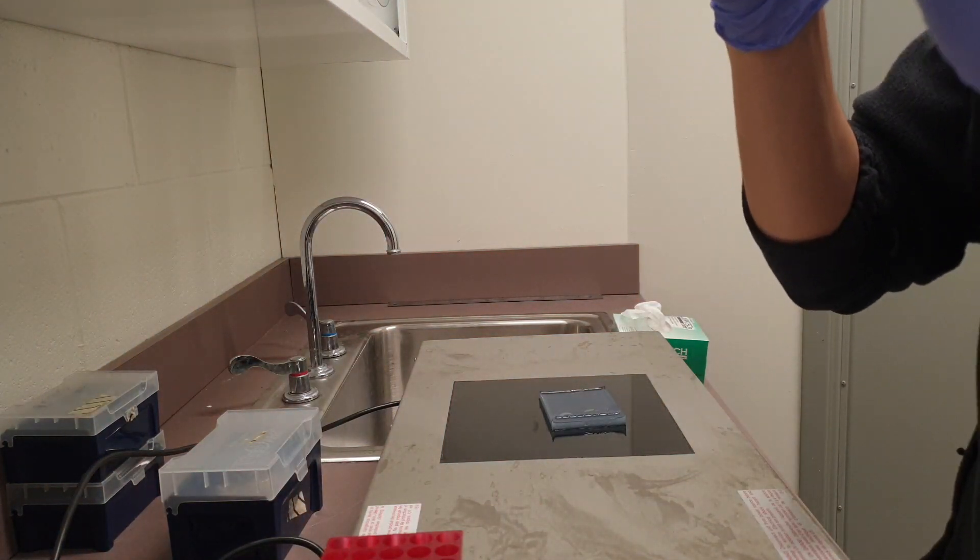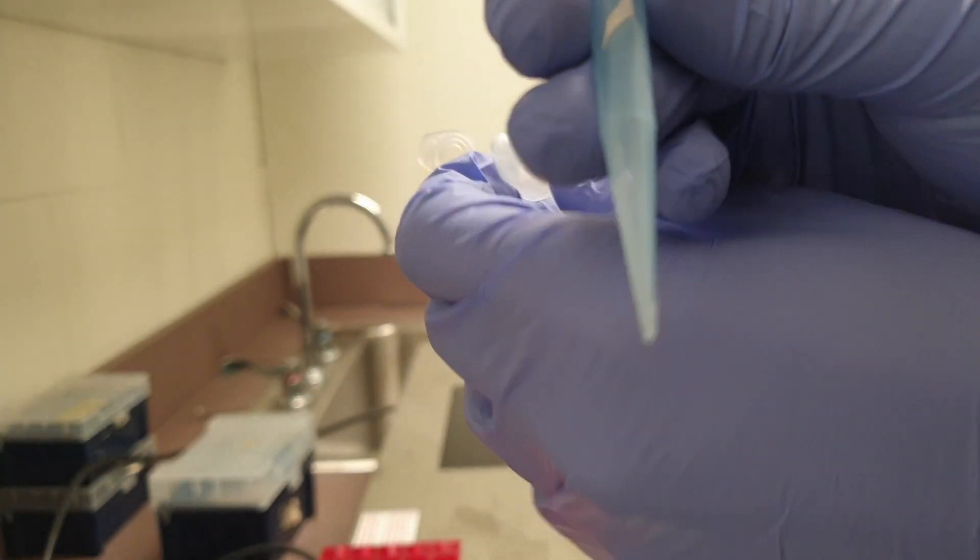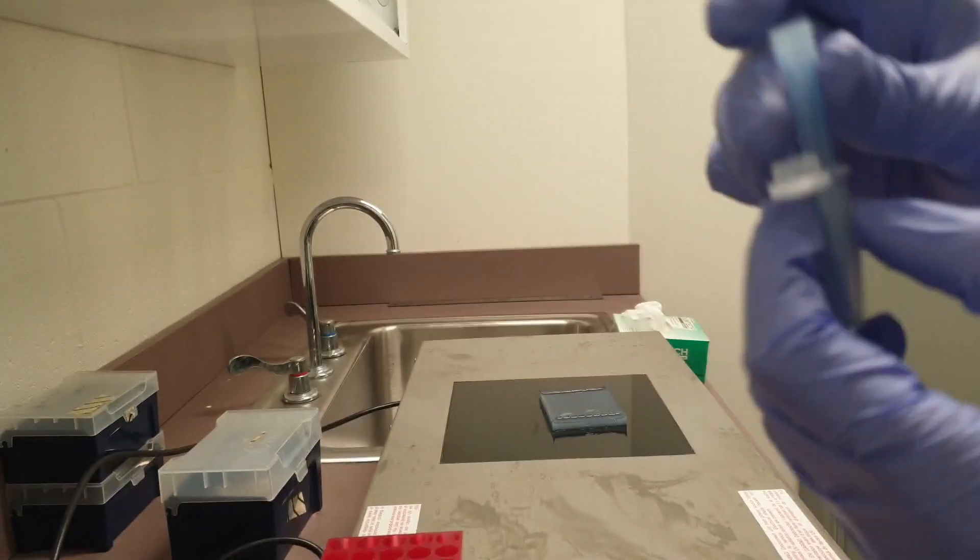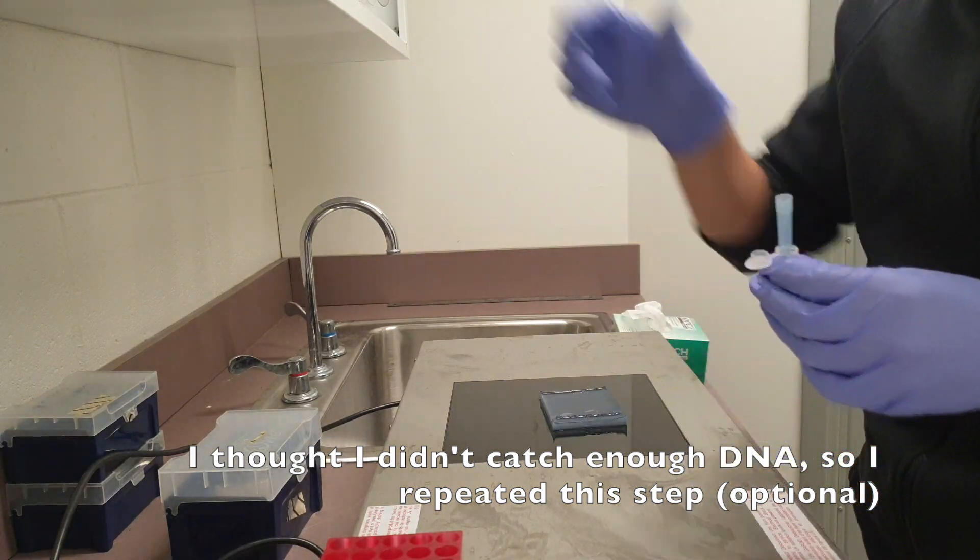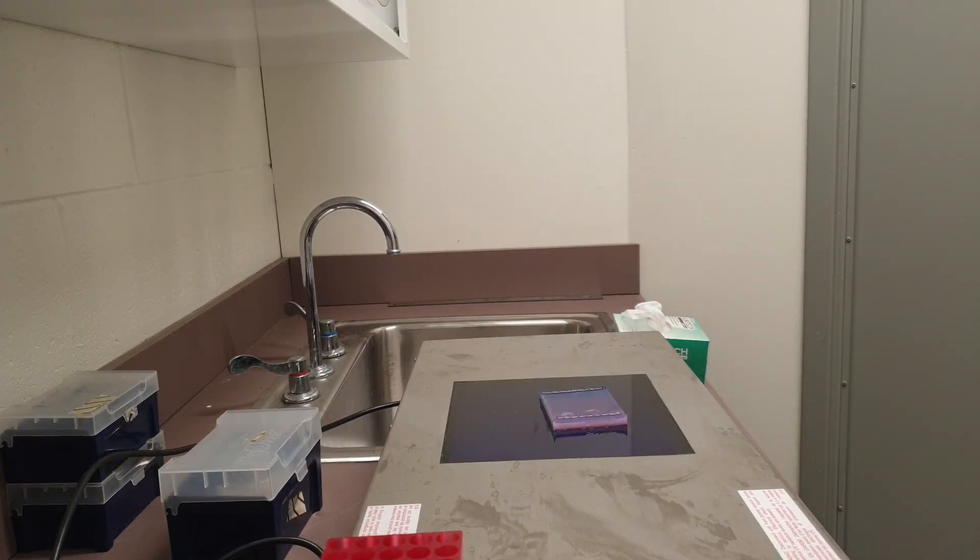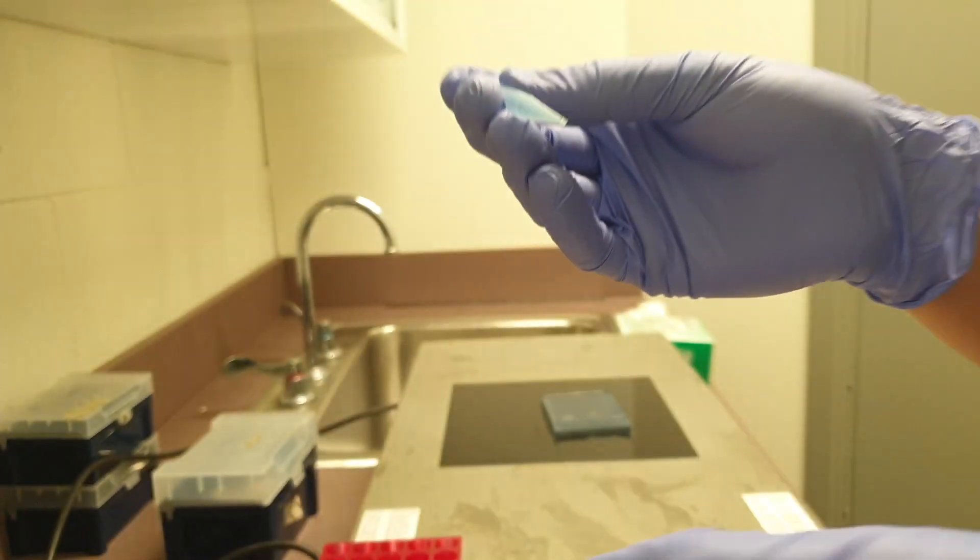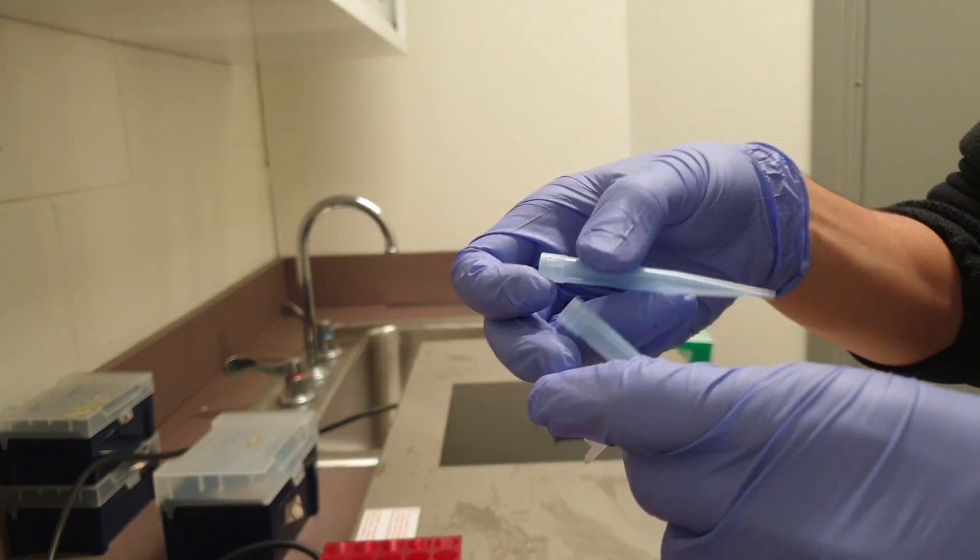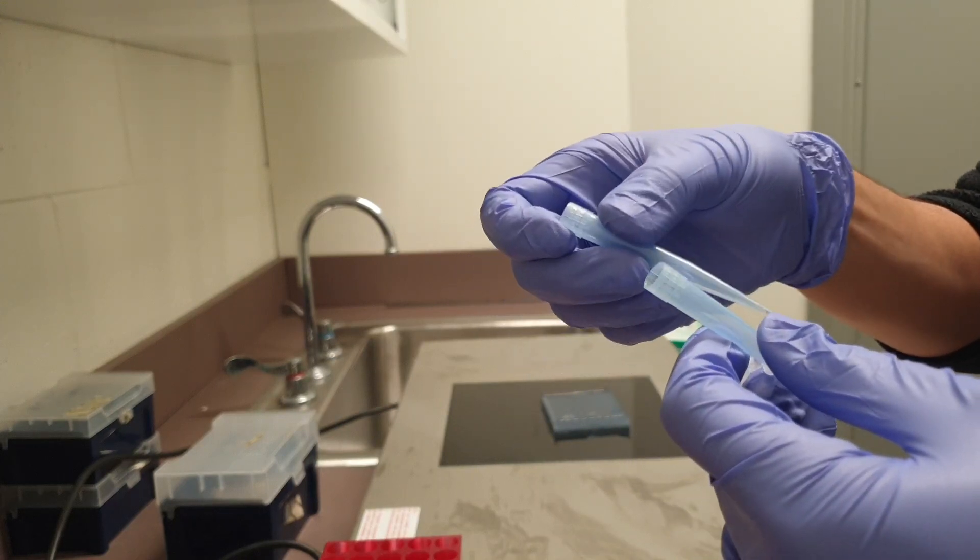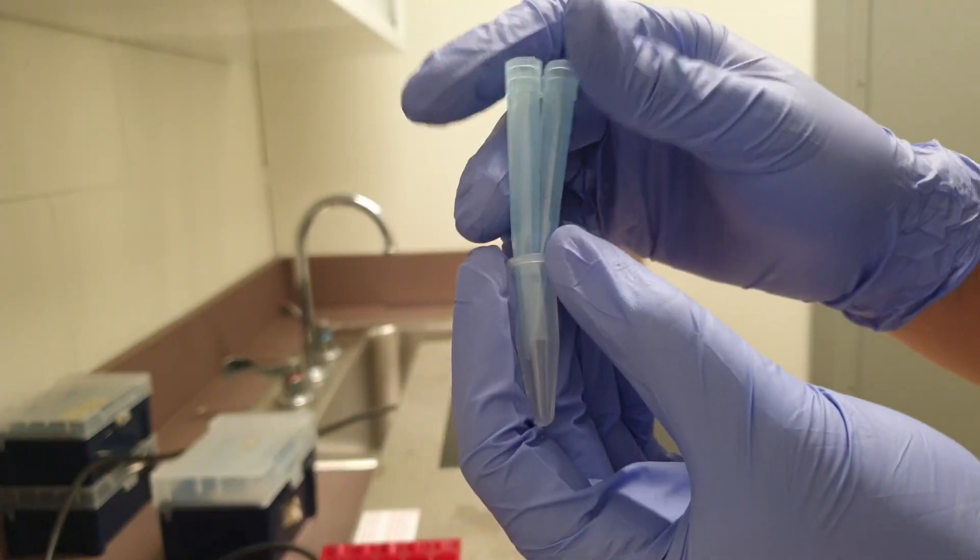That should be good. Overexposing yourself to UV can damage your eyes. I see that amount. I will extract just a little bit more. So let's repeat the process. Let's grab a new tip. Cut some more. Yeah, that's visible. And then let's just leave it inside the tube without touching it anywhere. Alright. So we're good now. Let's go back to the lab.